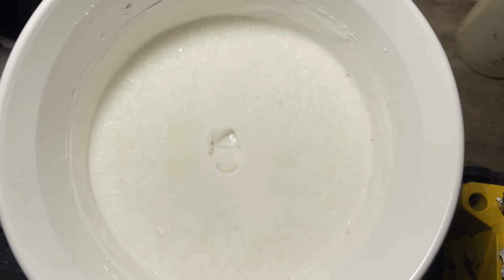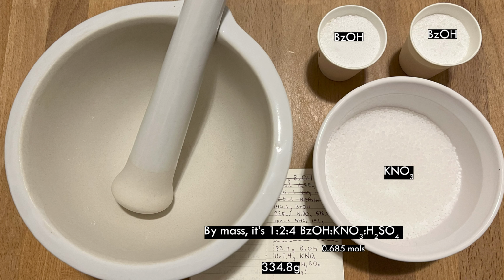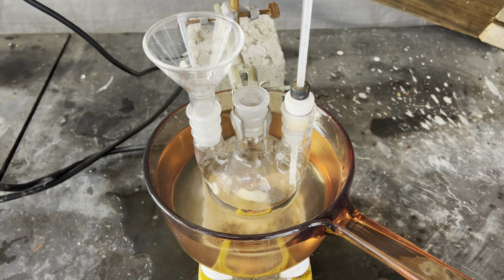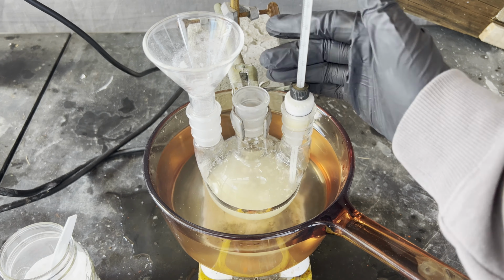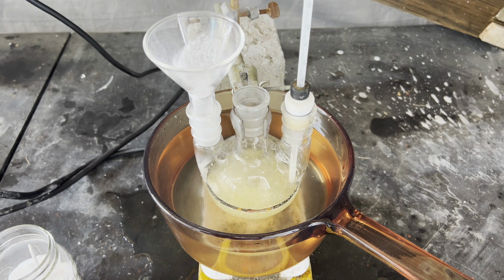Lastly, a direct nitration of benzoic acid with a twist. This procedure is very old, from 1877. More about that in the video description. I like the 1877 paper's method, not just because it's old, it also doesn't even use free nitric acid, it uses potassium nitrate. The nitric acid is formed in situ with this method.